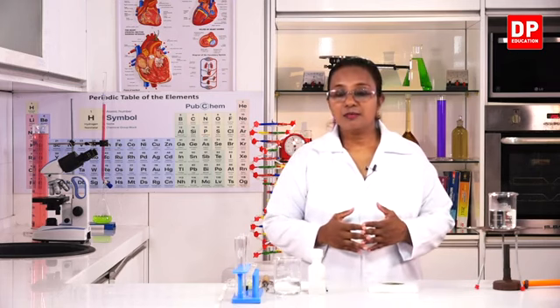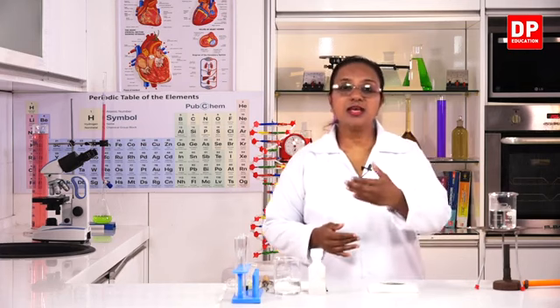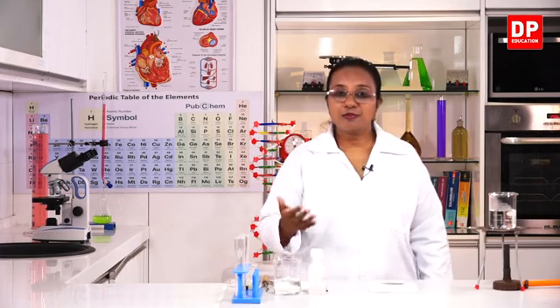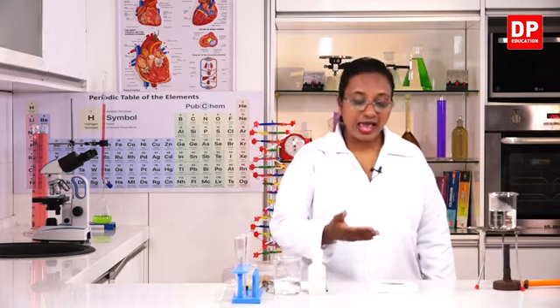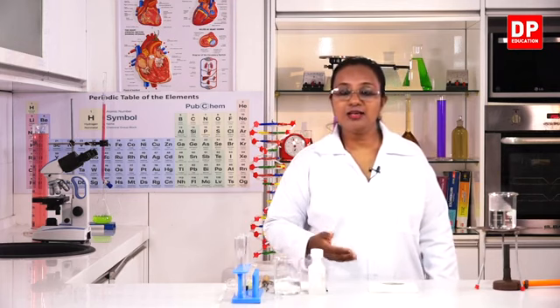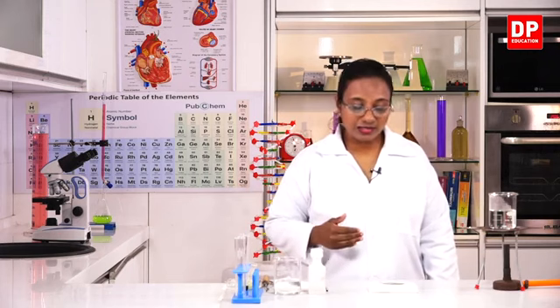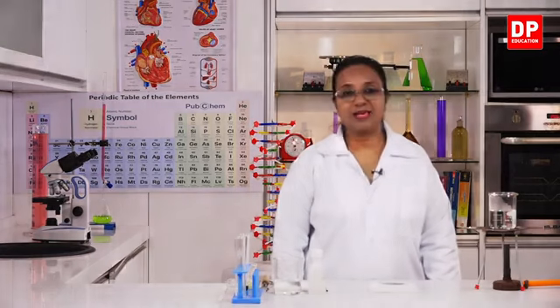If you can remember, students, we took the leaf from a plant that was exposed to direct sunlight for a few hours, and photosynthesis takes place in the presence of sunlight, and therefore we can see the color change with iodine, the dark purple or dark bluish black color formed when there is starch. So with this, we can confirm that photosynthesis has taken place.